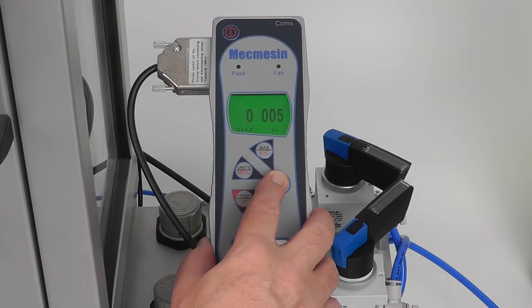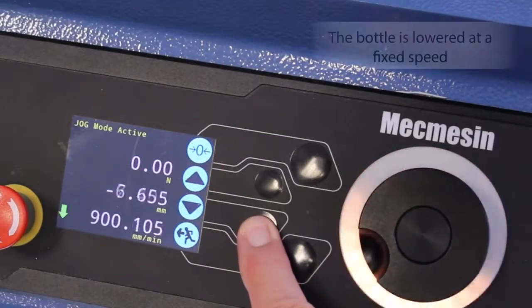The torque indicator is zeroed and the test started.